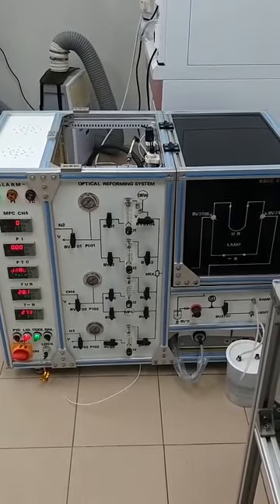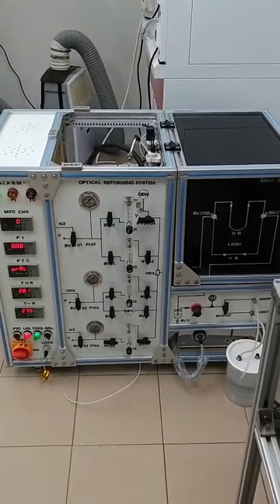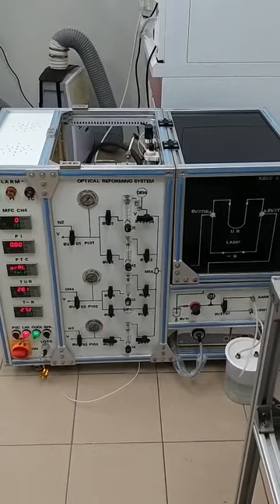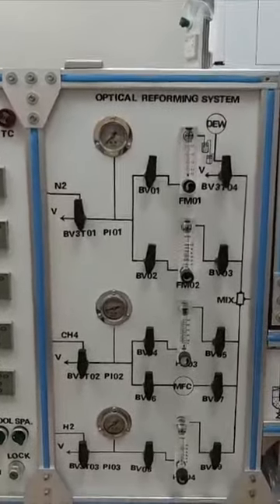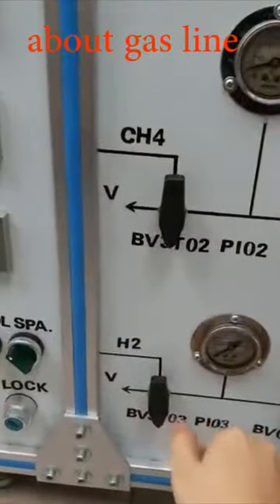Hydrogen is used for reducing the catalyst. You can use it or not use it. It's also dependent on your experimental inquiry. Okay, this is the full optical reforming system. We will start from the first gas, hydrogen.